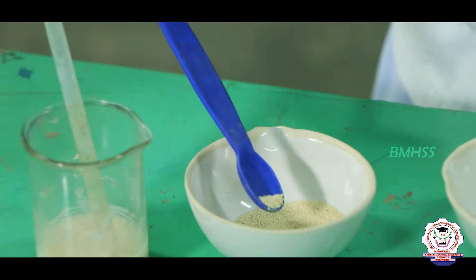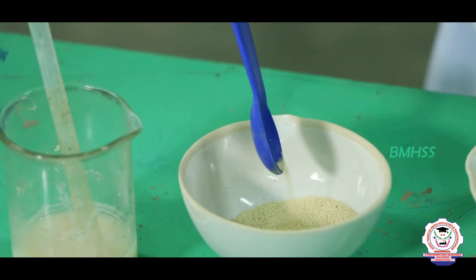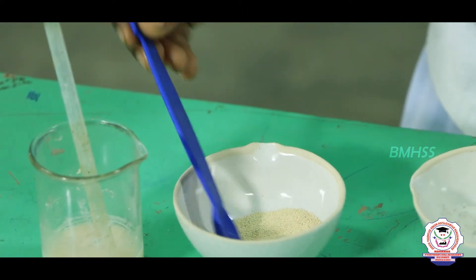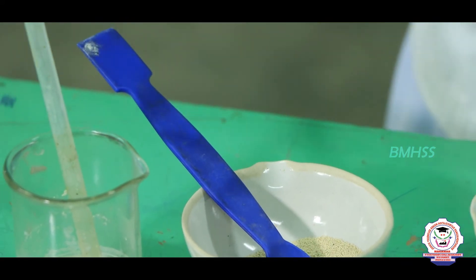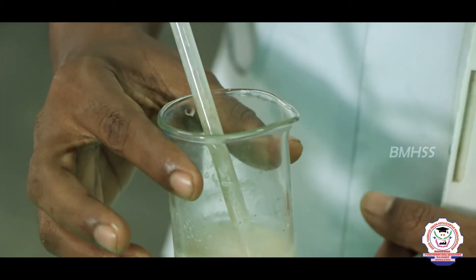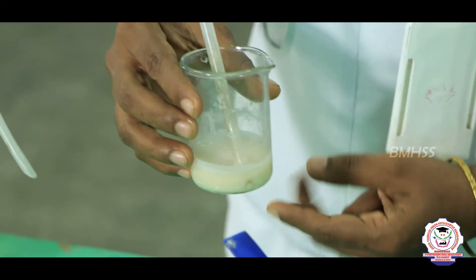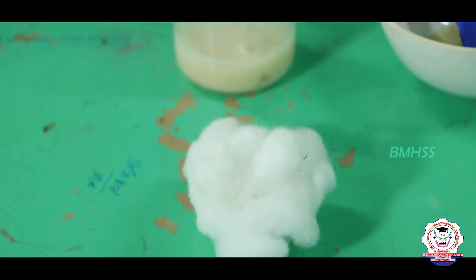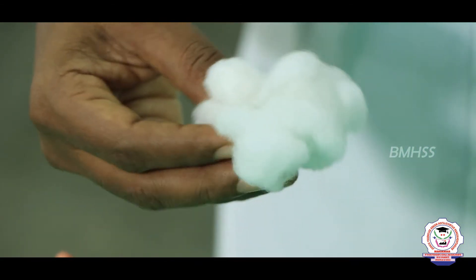The next important thing required for the fermentation experiment is yeast. This is a yeast granule — it is available in all supermarkets. This is the main ingredient used in the fermentation experiment and it is also used in making breads and buns; baker's yeast we say. This yeast makes bread or a bun very soft and porous. We have made the yeast solution by adding yeast and lukewarm distilled water. This cotton is used to close the test tubes after the experiment.